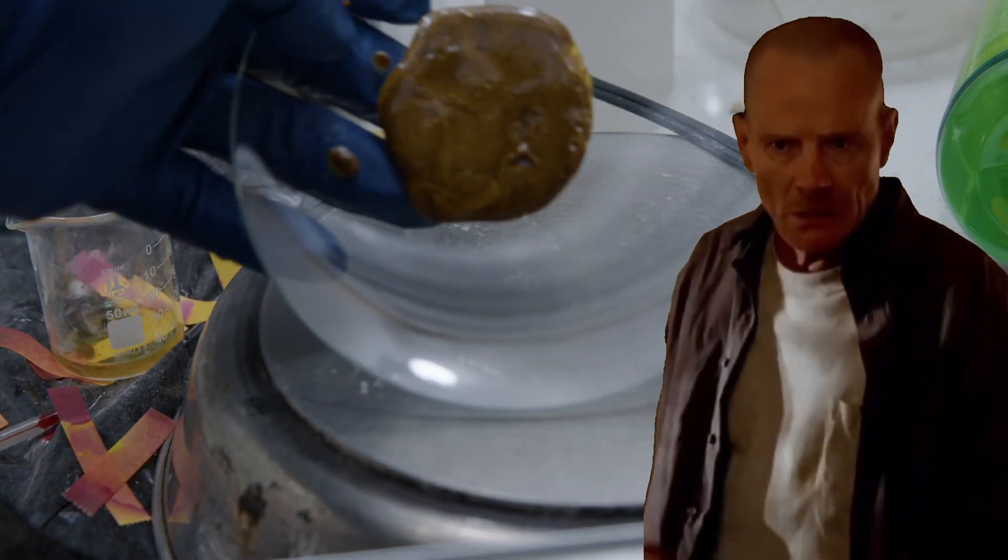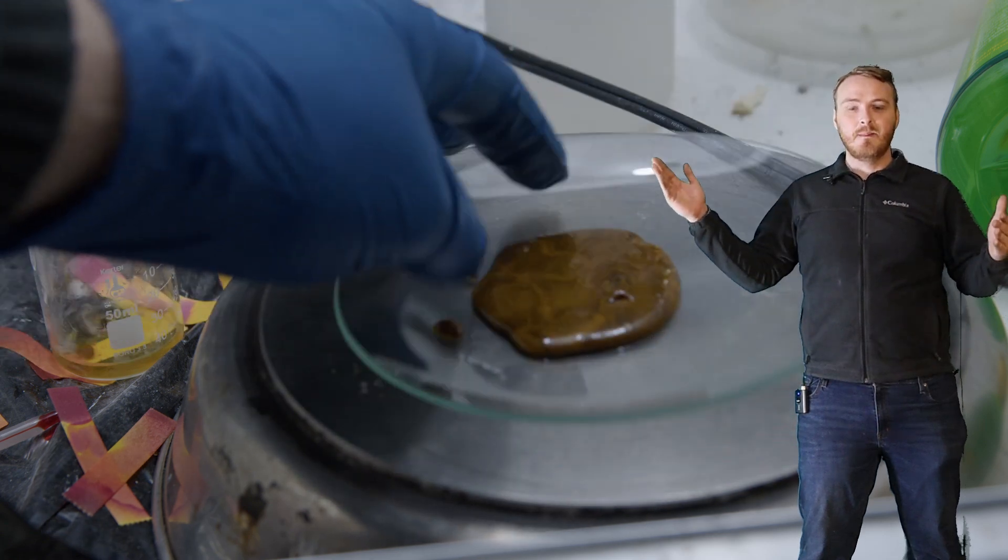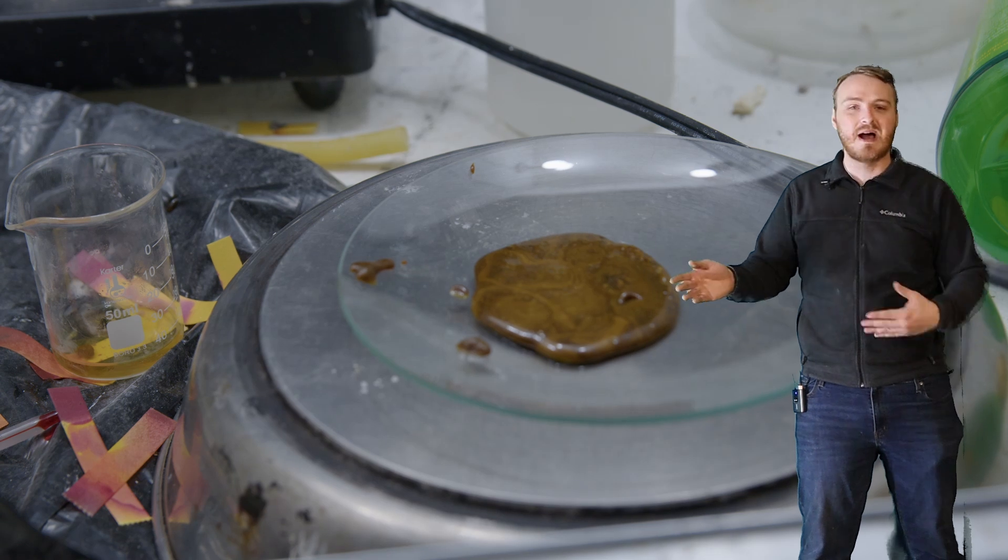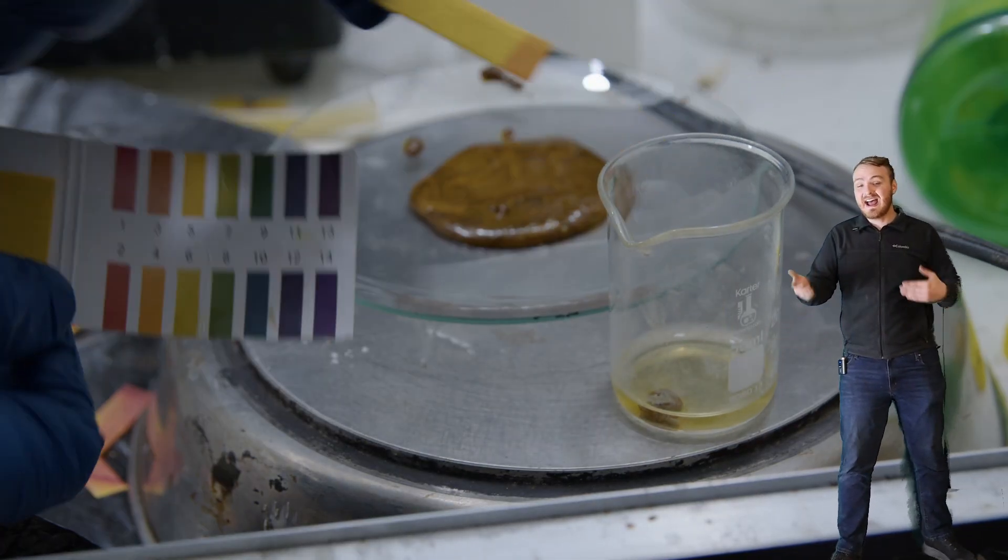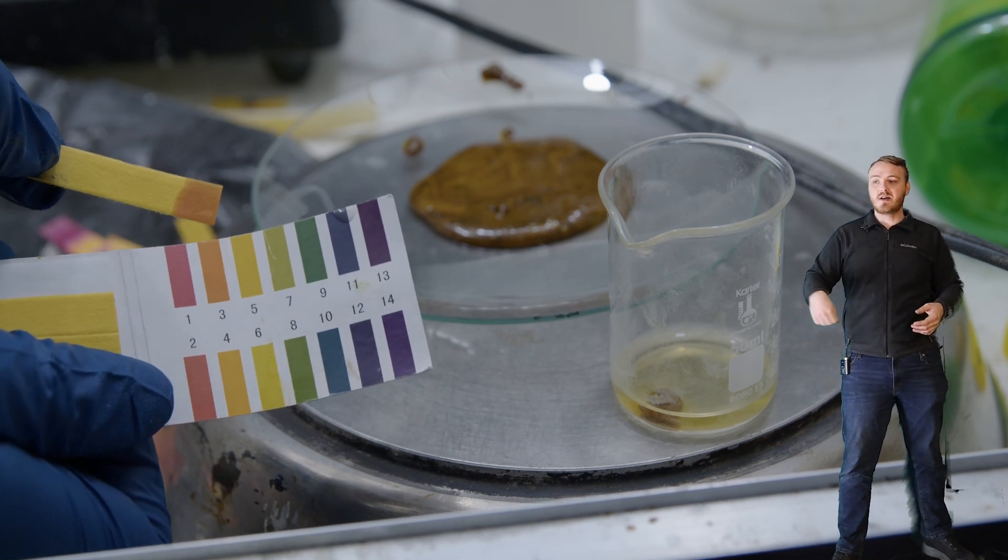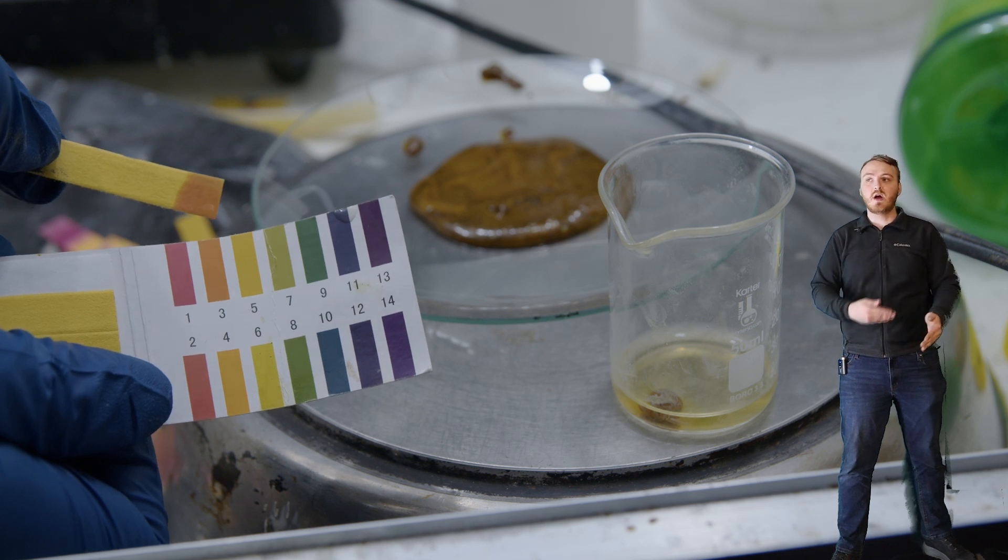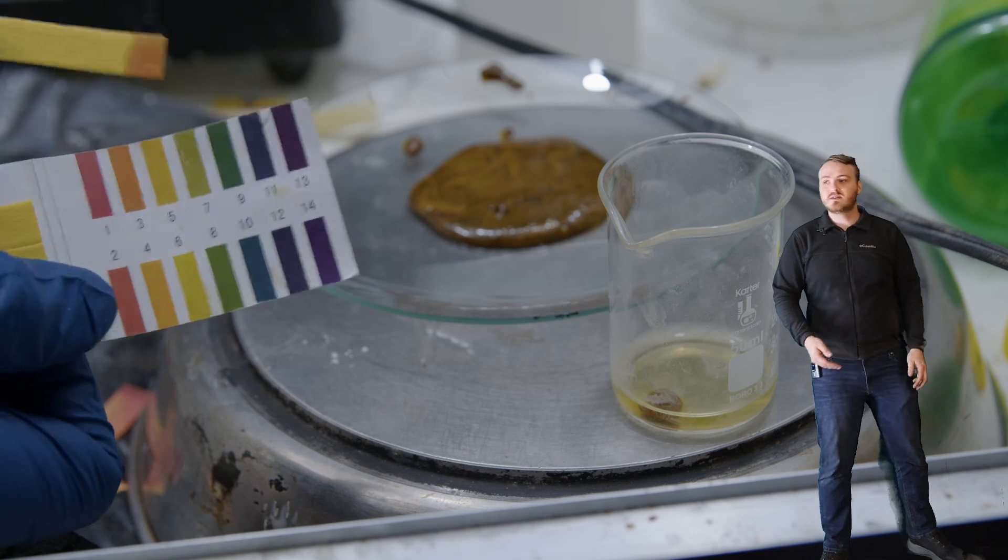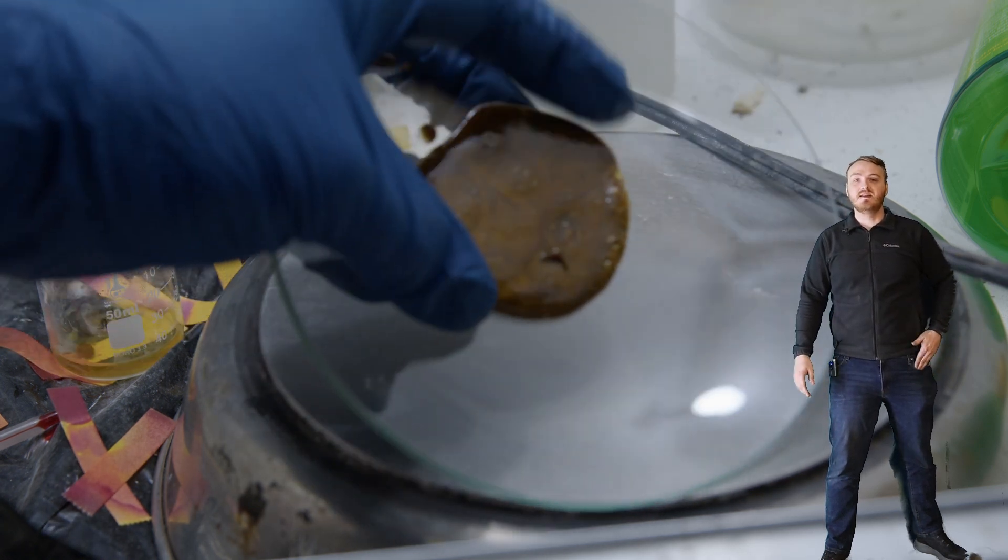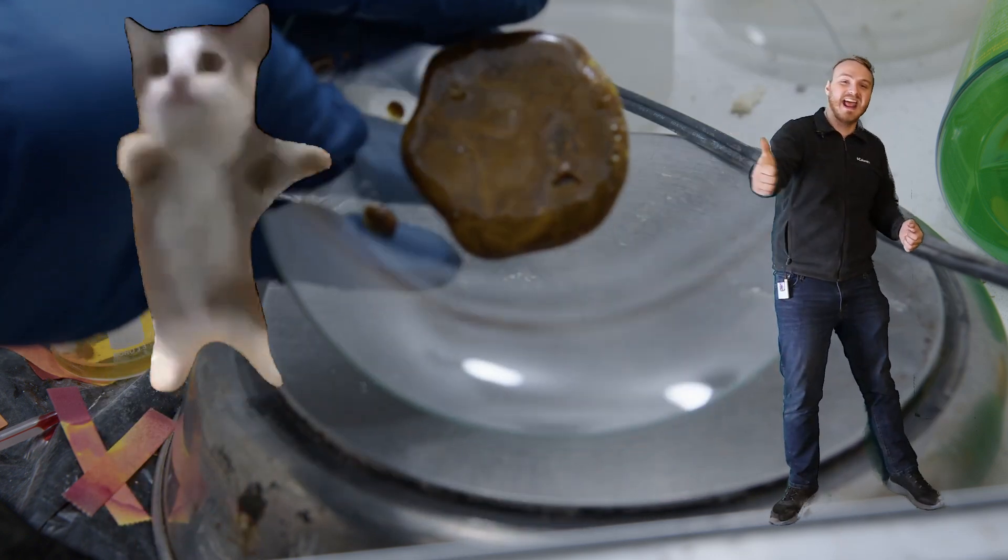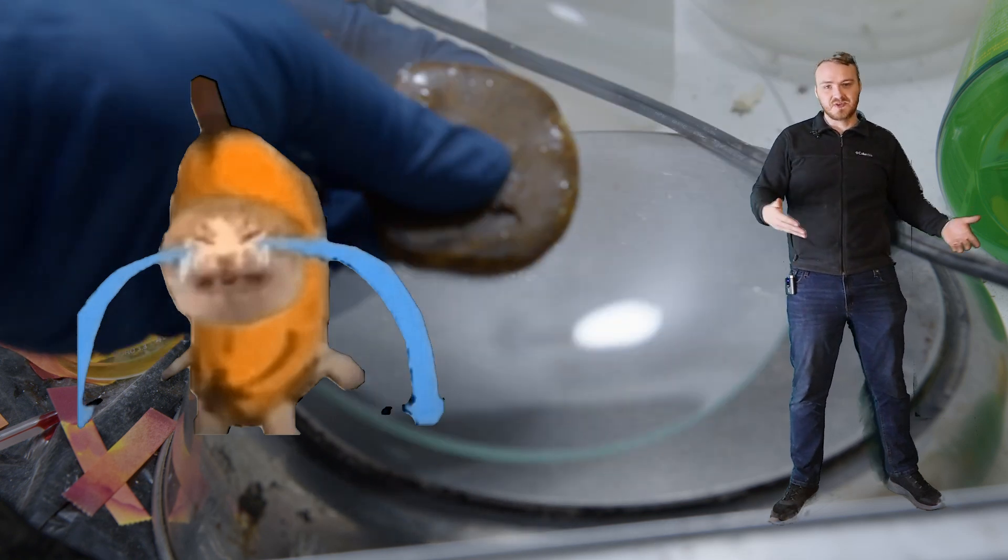What is wrong with you? Why are you brown? So yes, a student among you may realize that it's brown and citric acid is white, but lemons are full of like hundreds of chemicals. We were bound to get some stuff mixed in there. Ultimately, this is very impure, but is it citric acid? We can test this by taking a little piece, dissolving it in water and testing the pH. I tested this little piece in water and the pH came to pretty much dead on three, which is what should be expected from citric acid. It should be about three. So yeah, this is probably citric acid and like a bunch of other proteins and just gibberish. But ultimately, I give myself an A for effort and a B for outcome. This turned out not very good, but it was a fun experiment and it explains a lot of fundamental chemistry concepts.